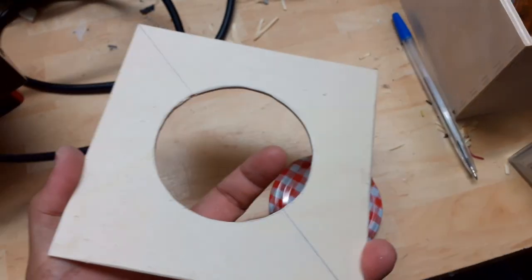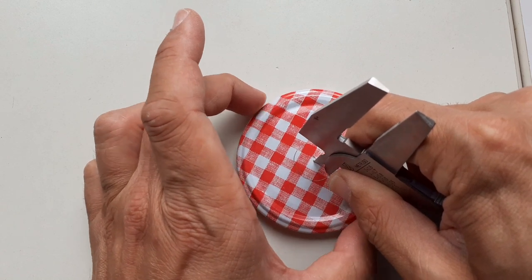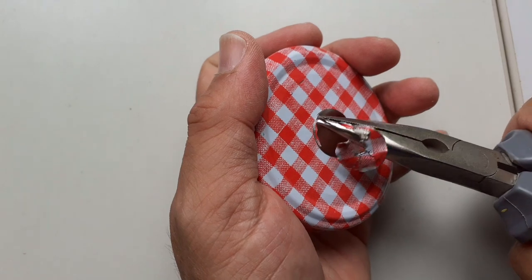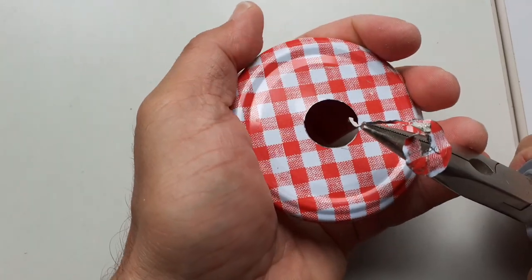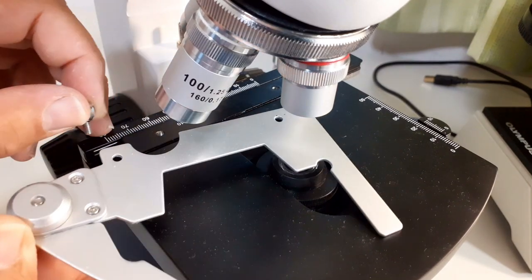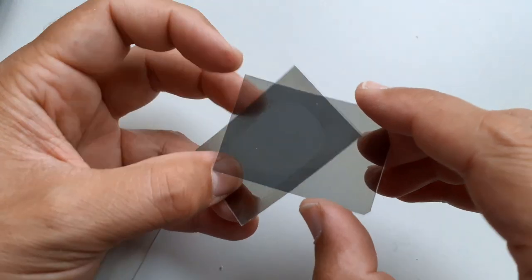Here we see the first trial where the central part of the lid has to be removed. I scored it and using pliers removed a round circle. This was large enough to accept the light from the microscope. I removed the mechanical stage.